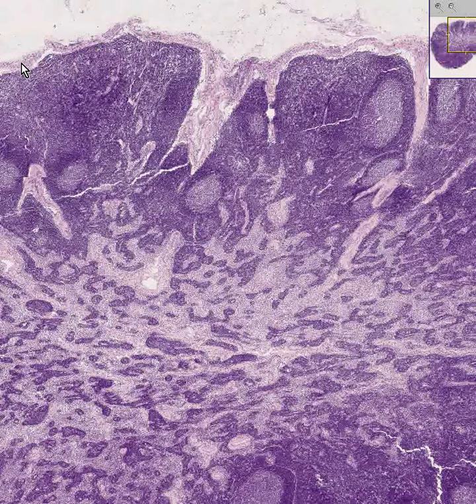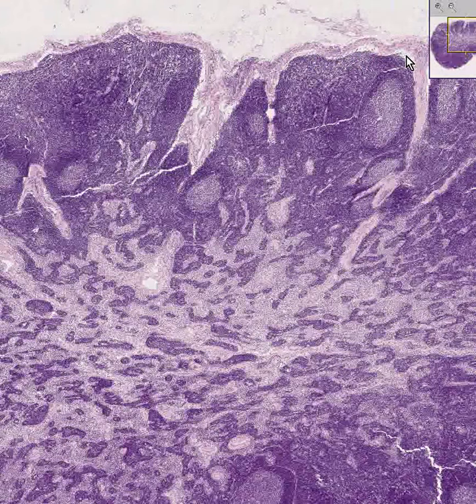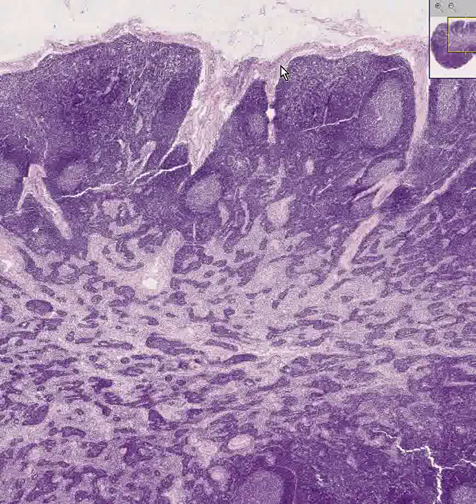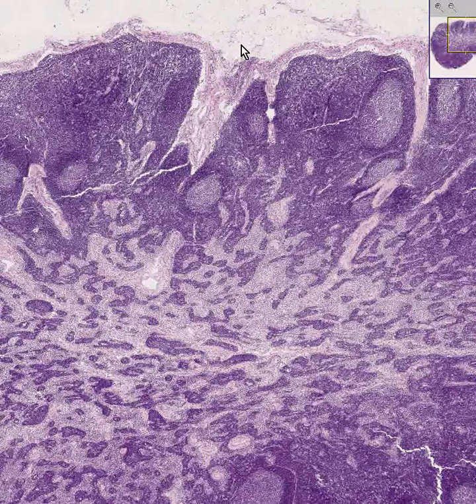First of all, it is covered by a nice thin fibrous capsule, predominantly fibroblasts and collagen. Secondly, there is a space underneath this capsule which is called a subcapsular sinus, and this is what is connected to the incoming or afferent lymphatics.